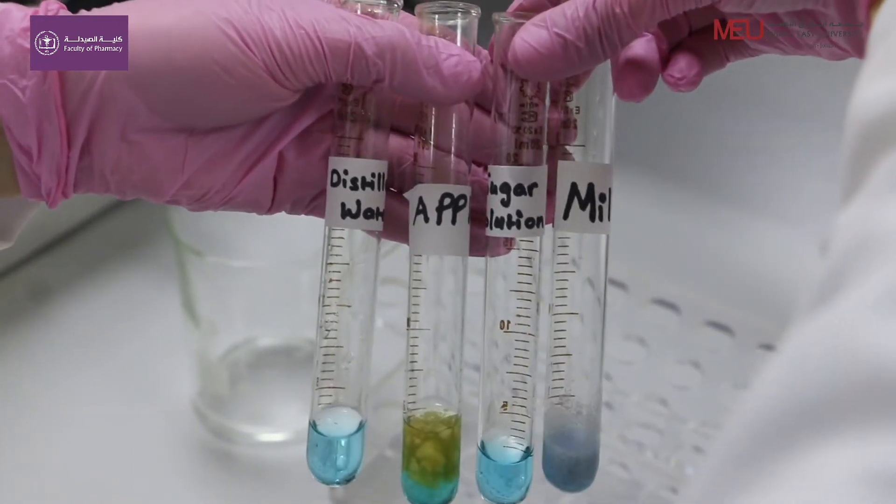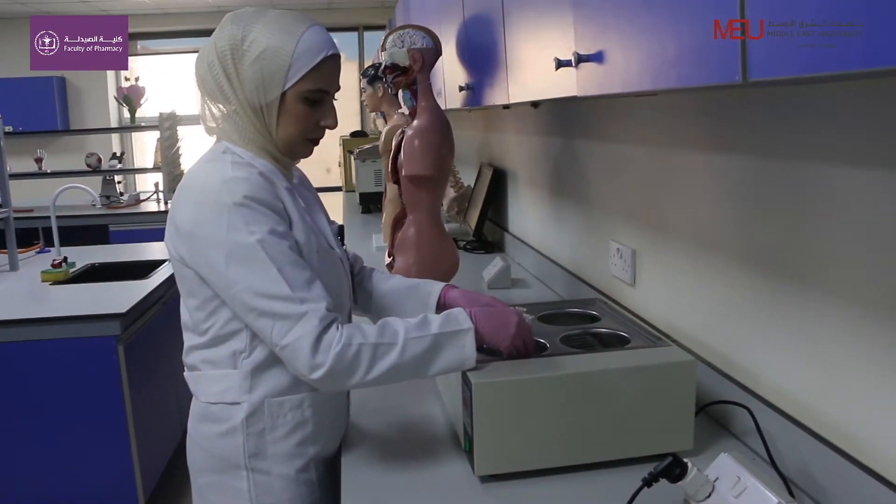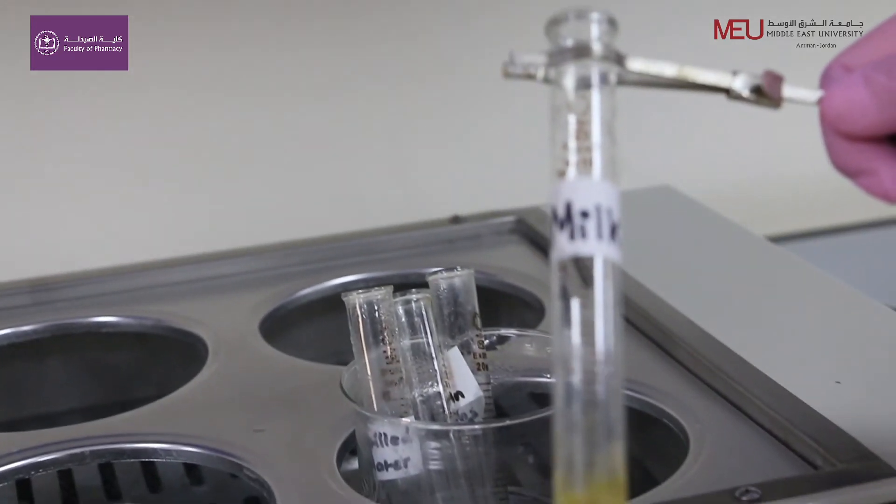Place the test tubes in a boiling water bath for 3 minutes, then observe the color change.